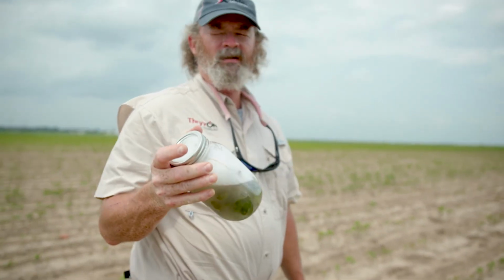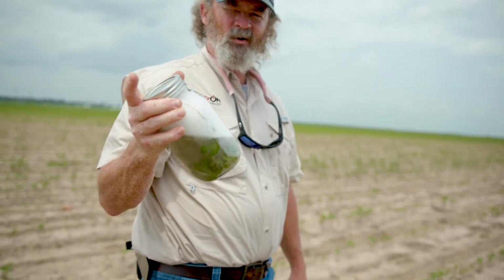After a while, this will be ready to process. It sits a little while, the insects die, of course. In this particular case, we're processing these in the field since this product's at such an early stage and is actually regulated at this point. We don't move the plants around excessively if we don't have to. So now we're gonna go up to the processing equipment. I'm gonna show you how we actually collect the insects from the sample after it's ready.